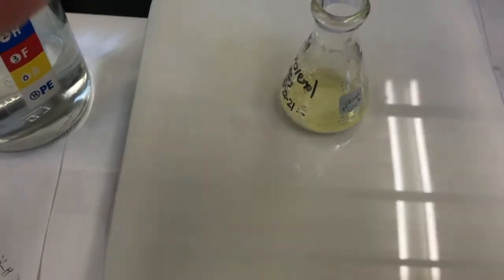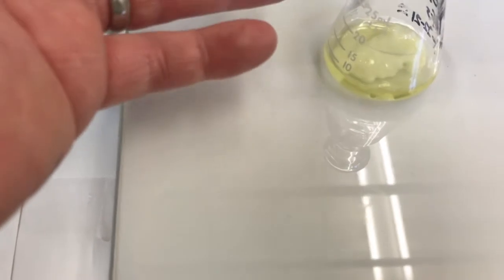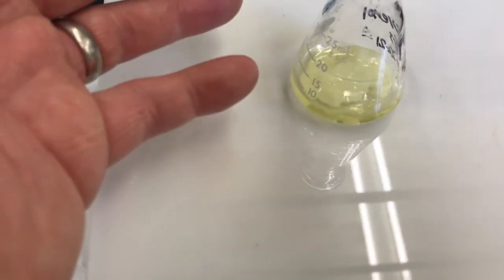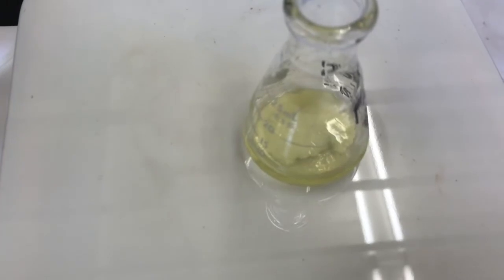And I'll watch this carefully because I don't want to step away and have it start boiling and evaporate all my solvent away. When the solvent's gone, the flask is no longer evaporatively cooling, so the glass gets super hot, and then it will burn and oxidize my product. I don't want that. So let's just be careful and wait for this to heat to a near boil.